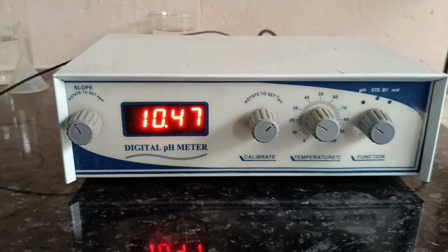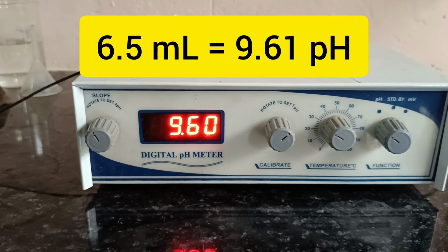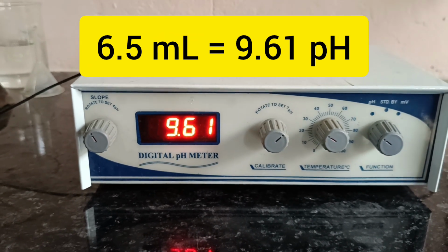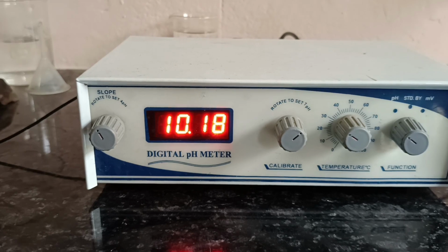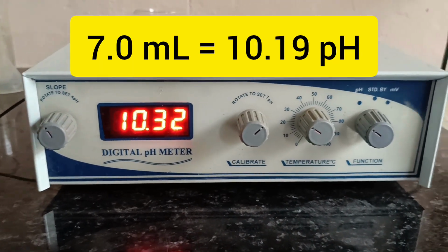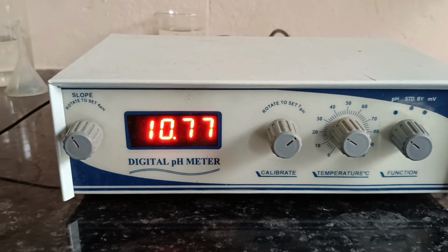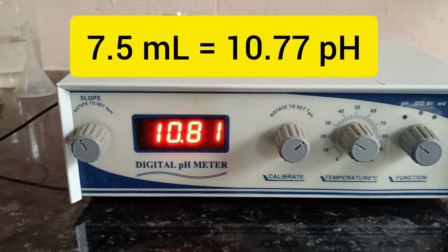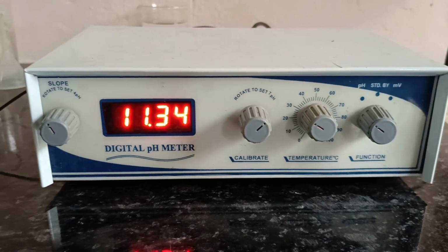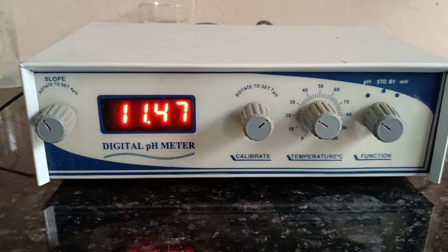Then 6.5 ml shows 9.61 pH. 7 ml shows 10. So it is because of the base solution, NaOH, that is added from the burette, and hence the pH range is above 7. 7.5 ml solution shows 10.77. 11.35 pH at 8 ml of the solution.